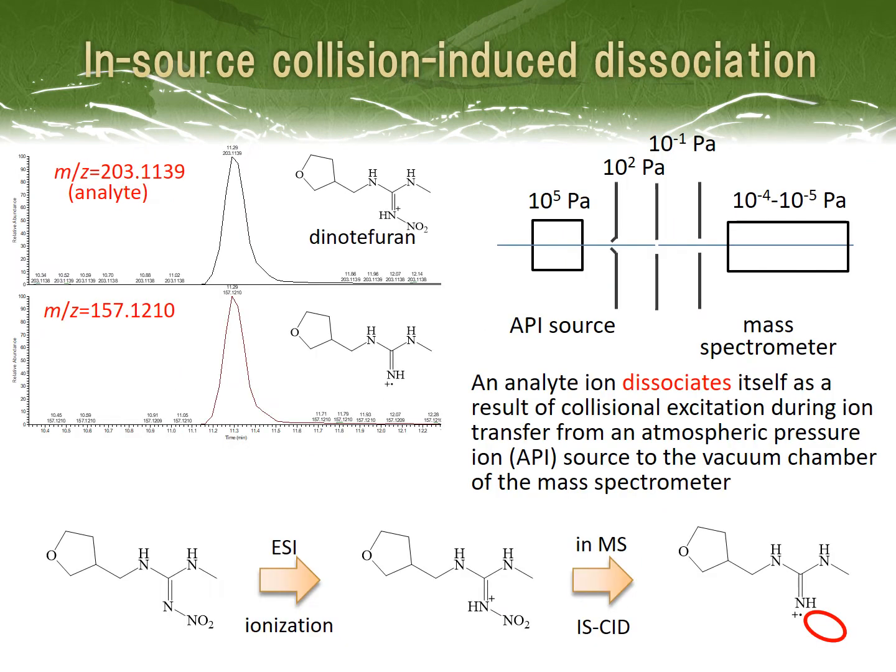Beware that you should not mix up an analyte's monoisotopic ion with an unintentionally produced fragment ion. An atmospheric pressure ionization, API, source like ESI is definitely a soft ionization technique. Most ions obtained by the API can stay intact, and only a few ions cannot, resulting in fragmentation. Please see the extracted ion chromatograms shown on the upper left side.